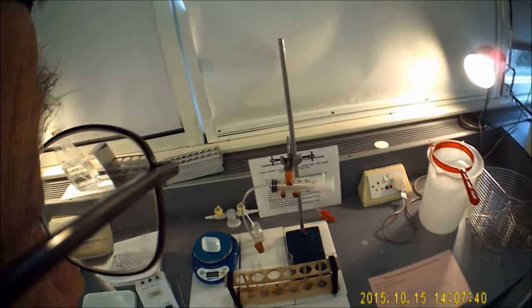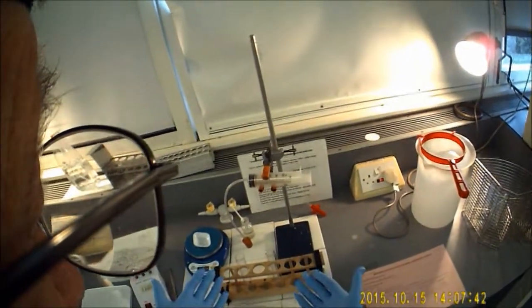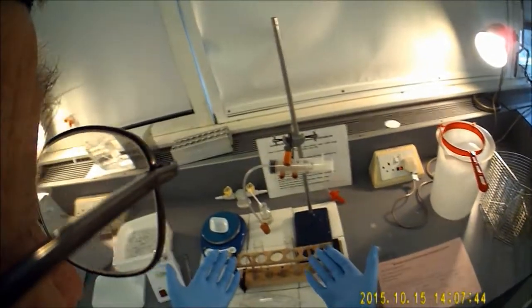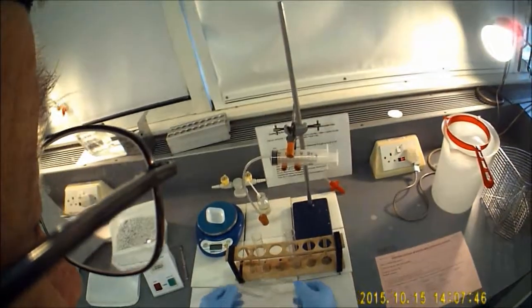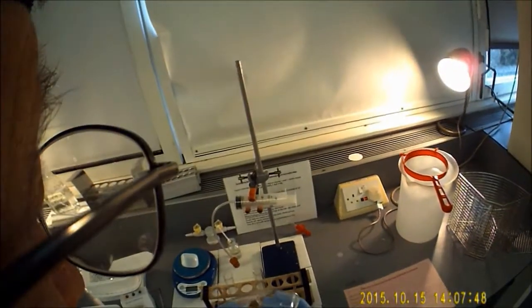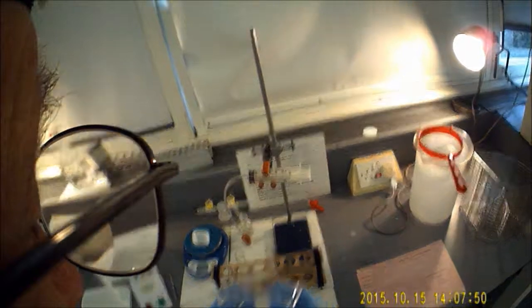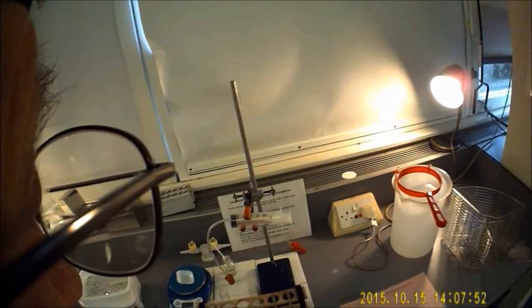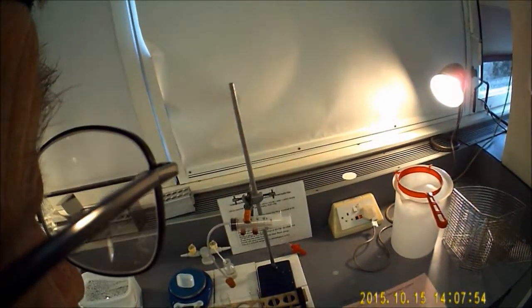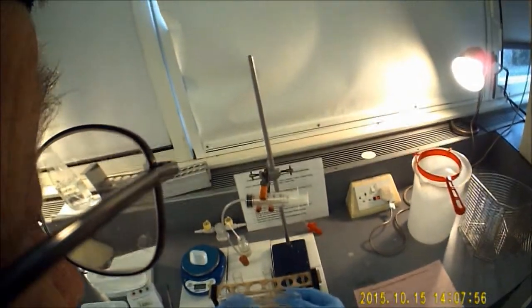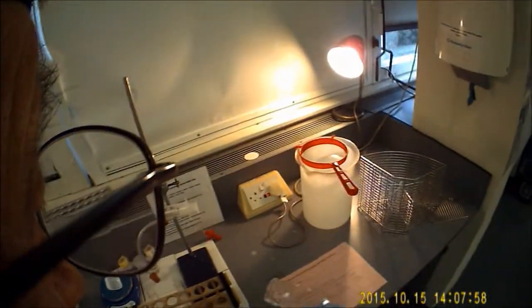When you carry out this investigation, you will need to wear gloves if you're the member of the group handling the acid, and you will also need to wear safety spectacles, goggles, or if you wear reasonably close-fitting spectacles normally anyway, they should give you the eye protection that you need.